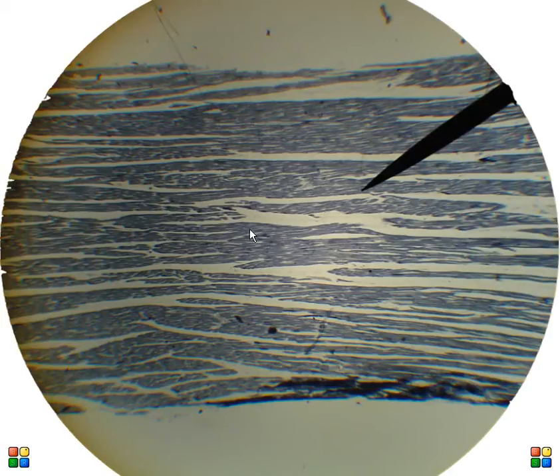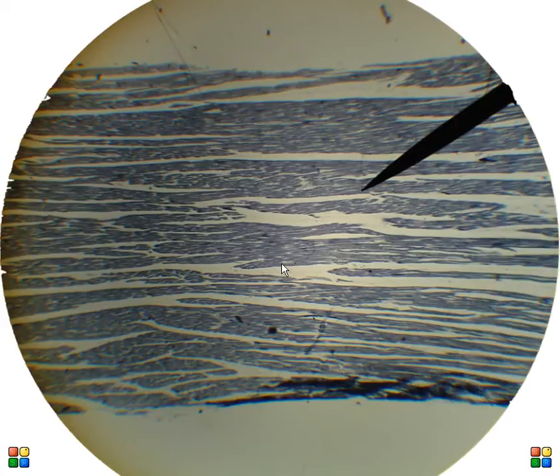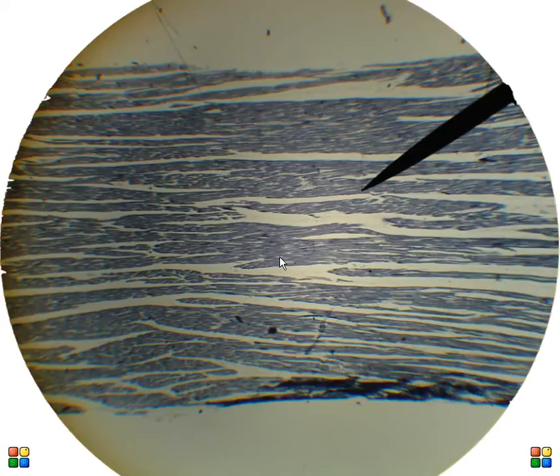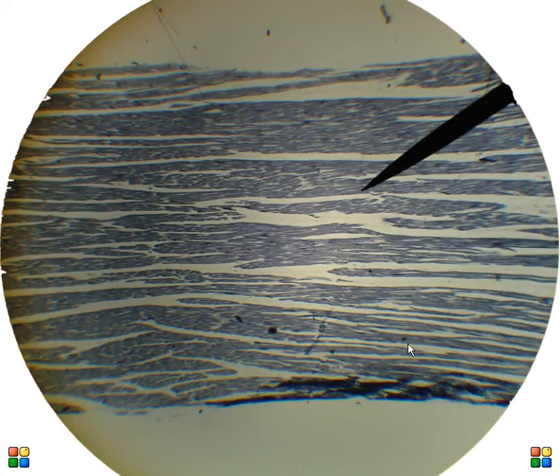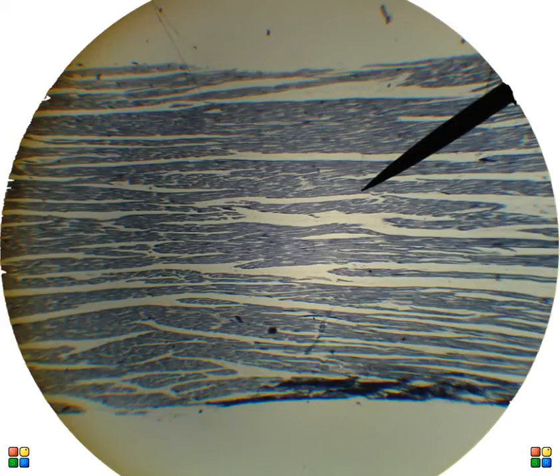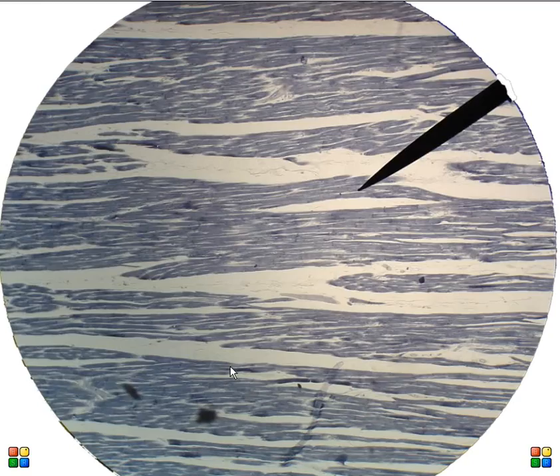This is a section of cardiac muscle under low magnification, 40 times magnification. Let's go to a higher magnification where we can start to make out some more structures.